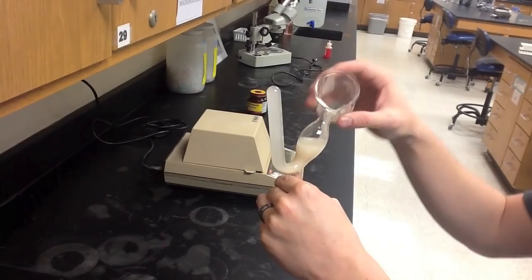We'll repeat this for any other samples that we have before transferring them to the incubator.